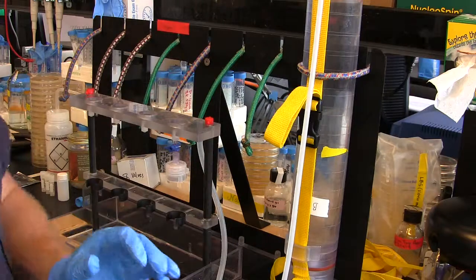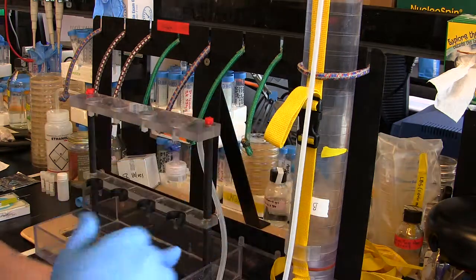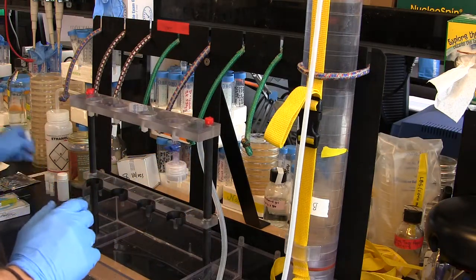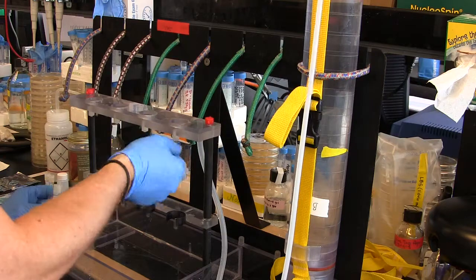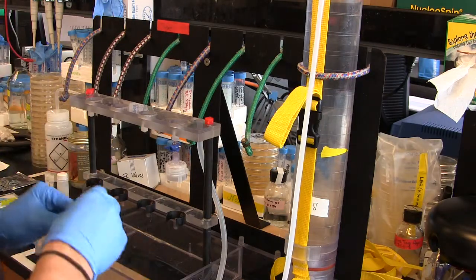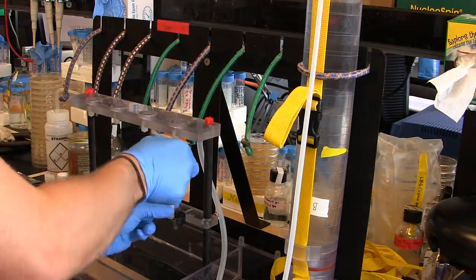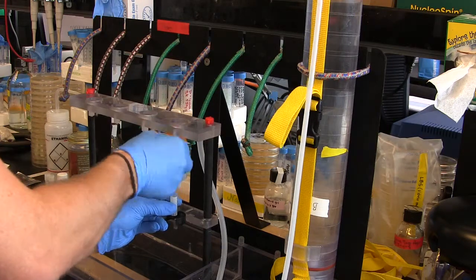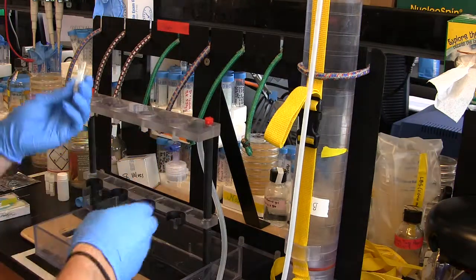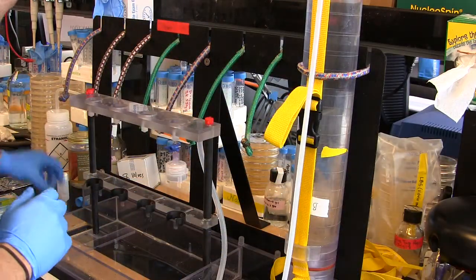Because these filters are so fine, if you don't take them out as soon as you're done using them you'll forget they're in there, add other filters on top, and then wonder why your water isn't filtering. So just run a little bit of water through that filter to wash out any impurities. Then grab your flow cytometry samples — fill them up to 1 mil or above. I've got about a 1.5 mil sample. Do that three times.